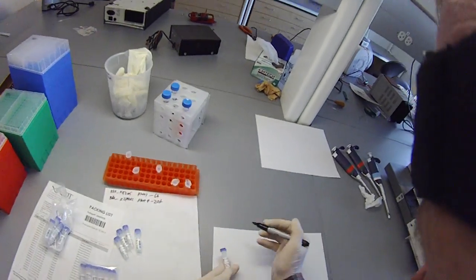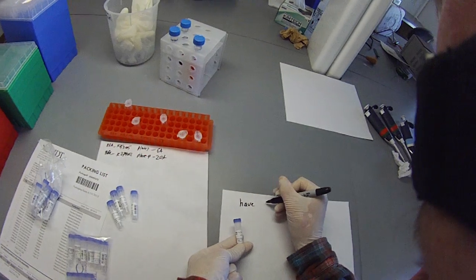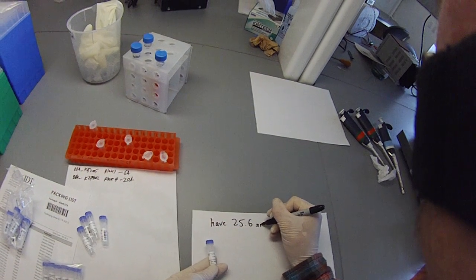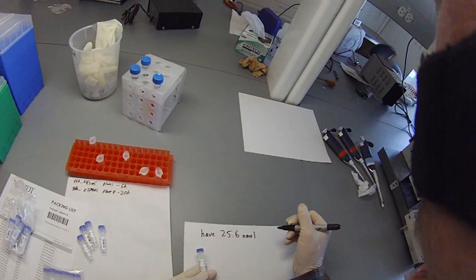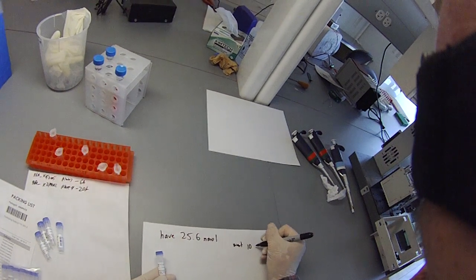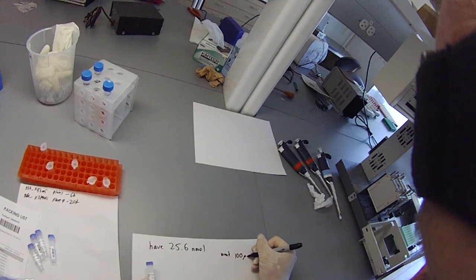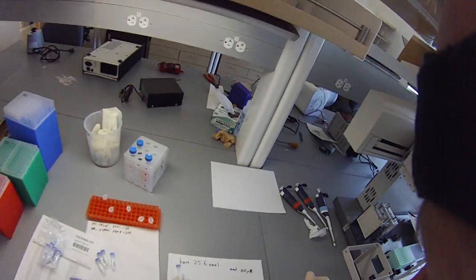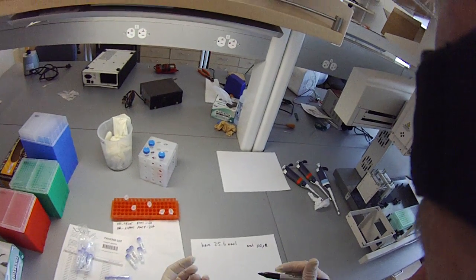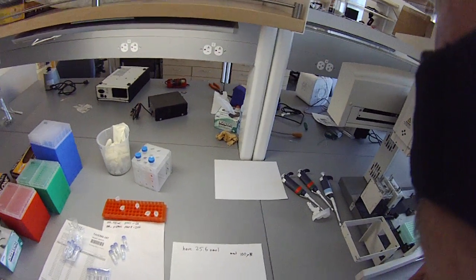So what we've got in this tube is 25.6 nanomoles, and we want 100 micromolar. We need to do some math here.